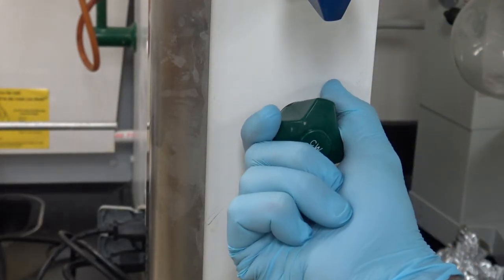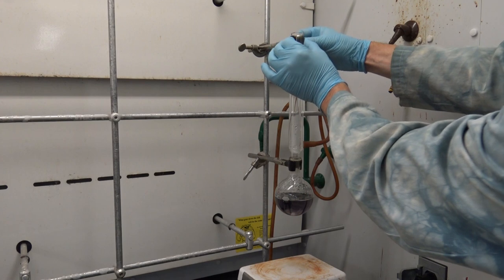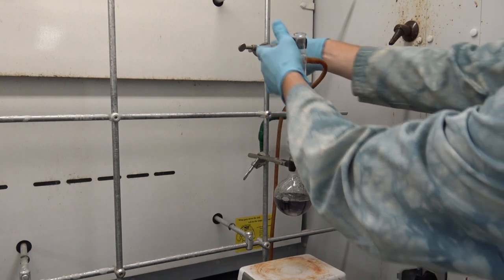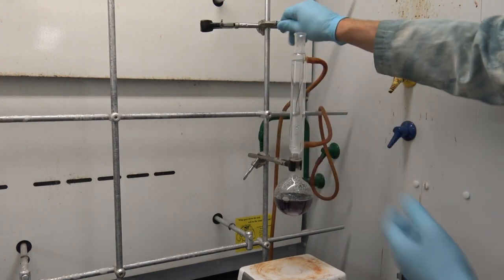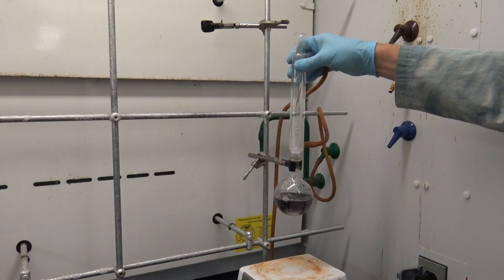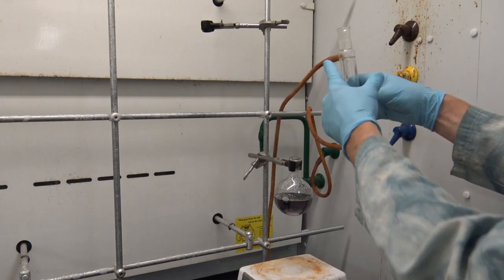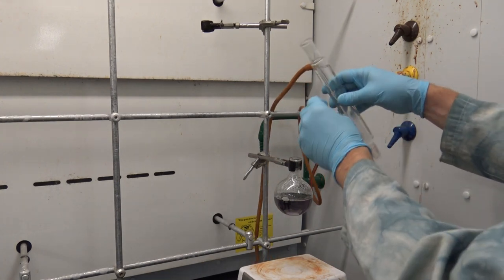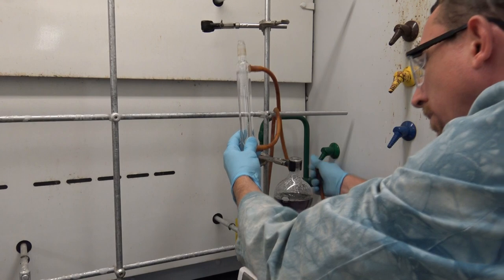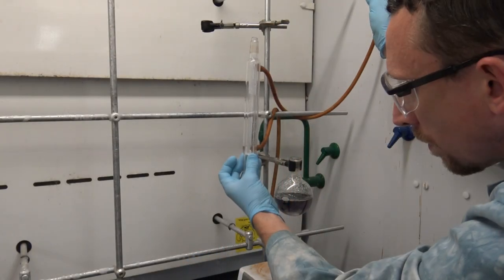To do this, I'm going to have to first deactivate the flowing water. And now I have an interesting challenge here. I have to remove this condenser without making a mess. In order to do this, I'm going to first naturally unclamp it from the rail. And once it's free, I'll remove it from the round bottom flask, keeping in mind that the drain hose is the one on the top. That's where I want the water to flow. So, in order to get the last bit of water trapped in my condenser to flow into the cup sink in the back of the hood through that hose barb, I have to invert my condenser. Now I can remove the supply line, and raise it above the level of the hose barb on the condenser, allowing it to drain into the cup sink without making a mess.